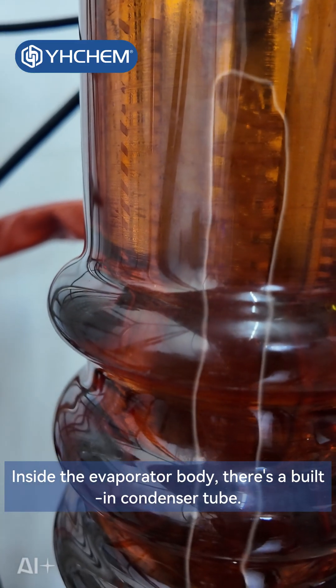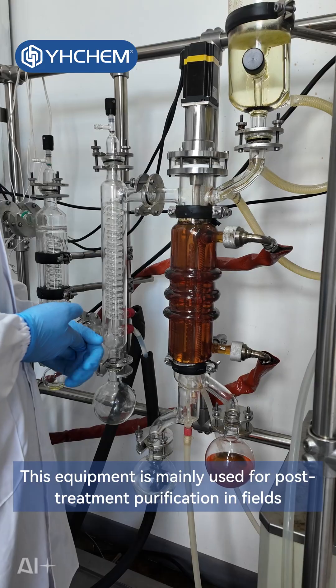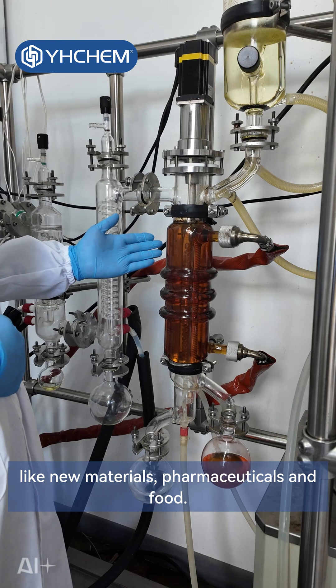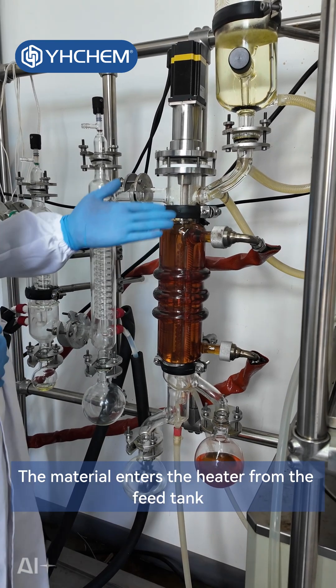Inside the evaporator body, there's a built-in condenser. This equipment is mainly used for post-treatment purification in fields like new materials, pharmaceuticals, and food.